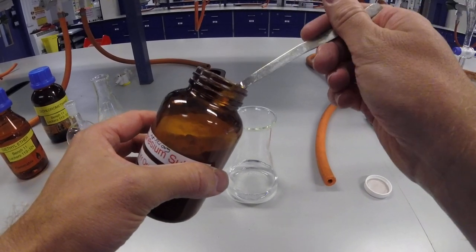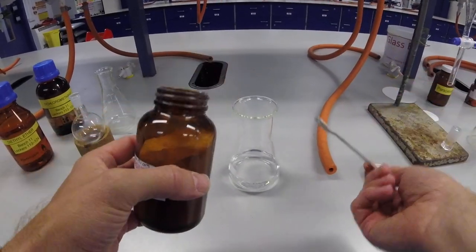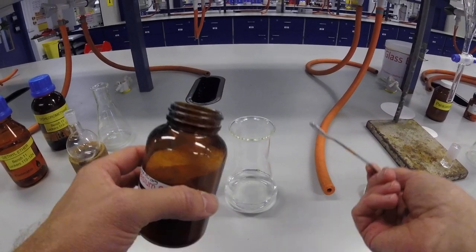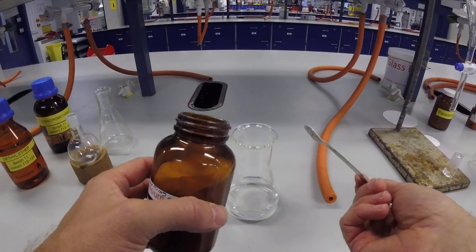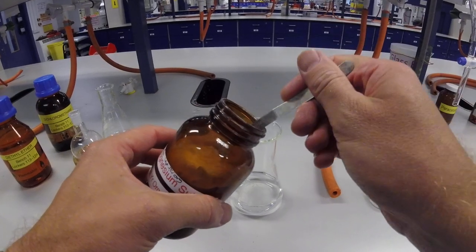The important thing, it's an inorganic compound, so it's not soluble in organic solvents. And also, the hydrate that's formed isn't soluble either, so we can filter that off afterwards.